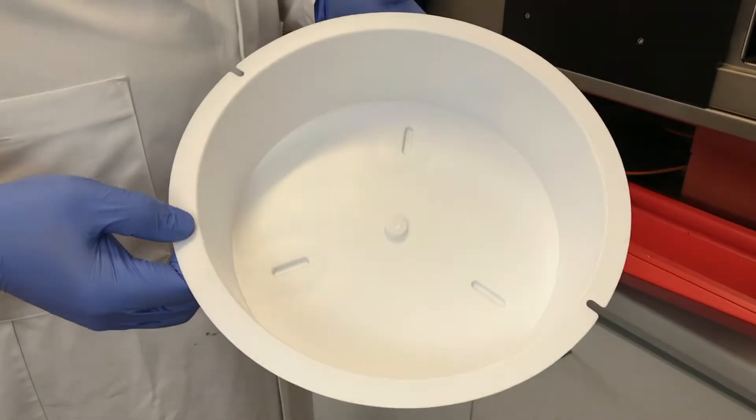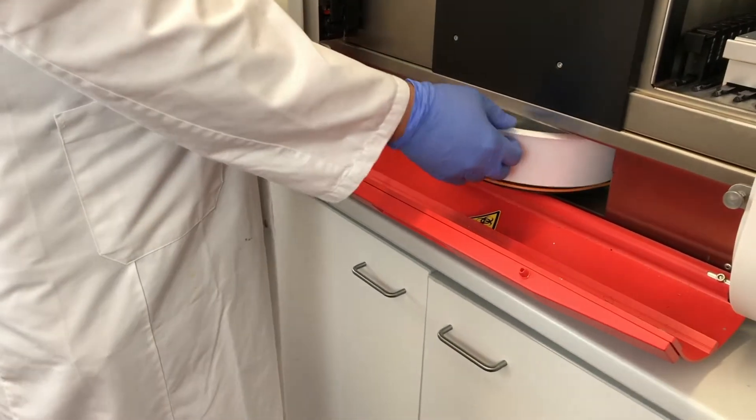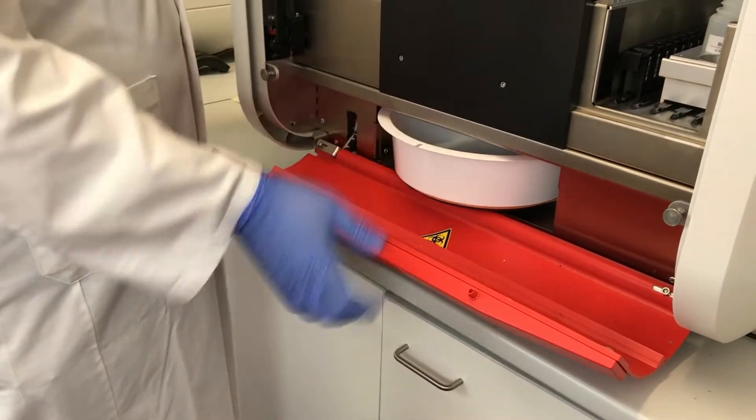After loading all consumables, check the waste tray. Waste is collected below the device. The waste container is rotating.